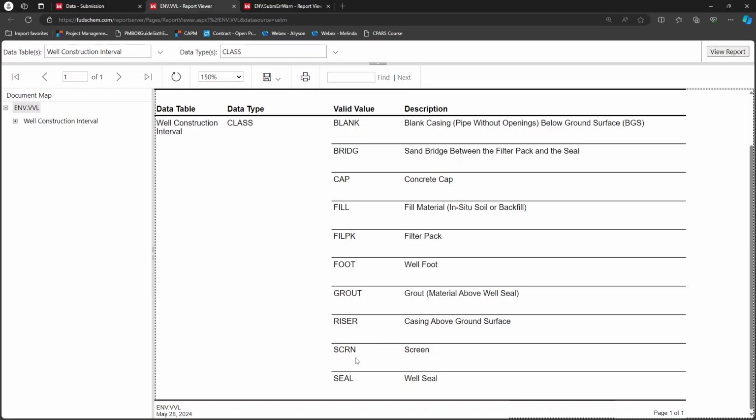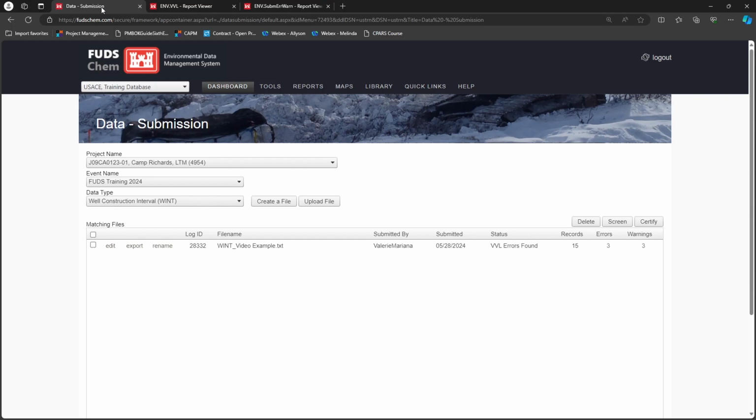Once you determine what needs to be updated, you would go back to the data submission interface. If you use the Create a File option, you would need to click the Edit button next to your file and make your updates in the interface. If you uploaded a file, like we did for this example, you would need to update the file and re-upload it.